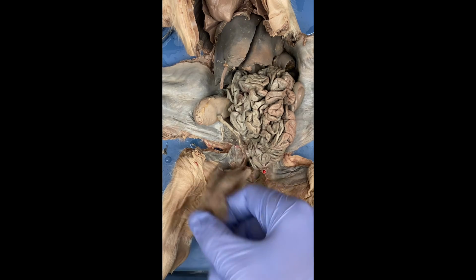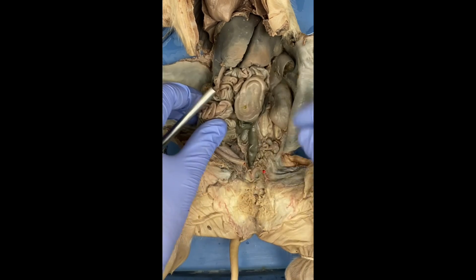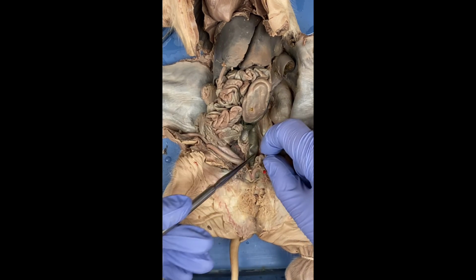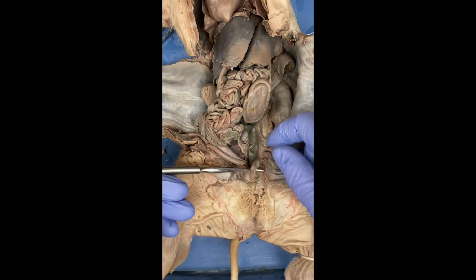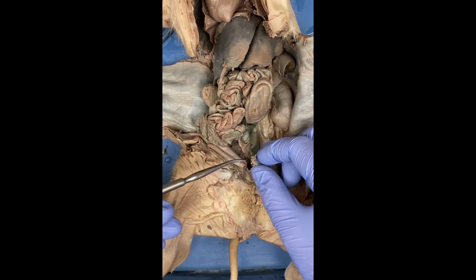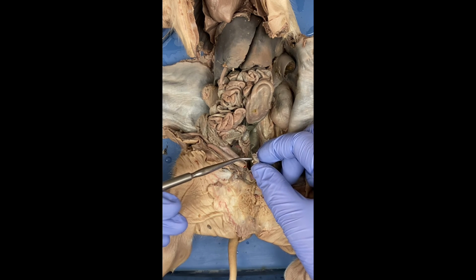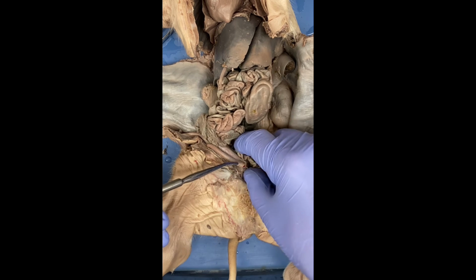Next, we're going to have the ovary. In order to see that, I have to move this aside, move this up, and here we have, right at the end here, is the ovary. The purpose of the ovary is to store eggs and then release them over time. There's two ovaries, one on each side, a left and a right.